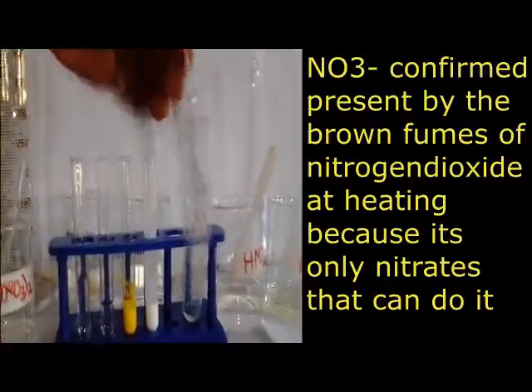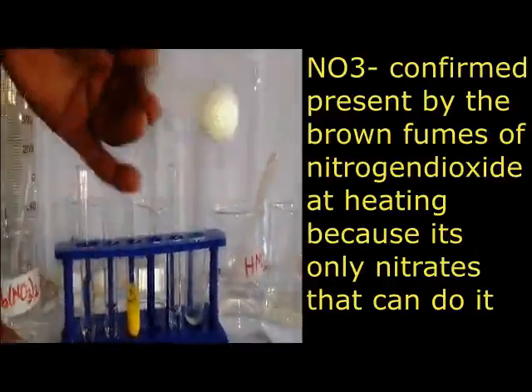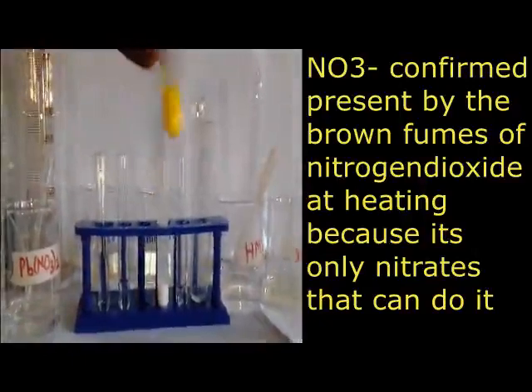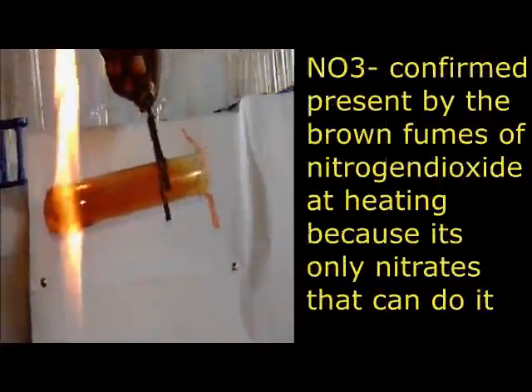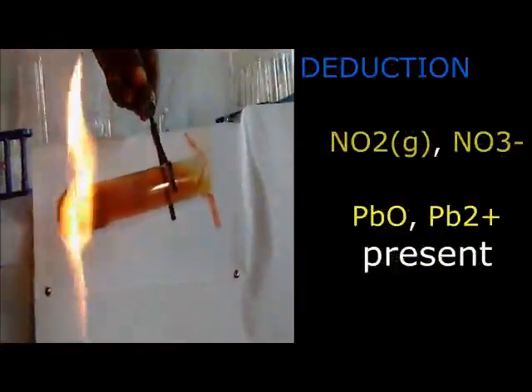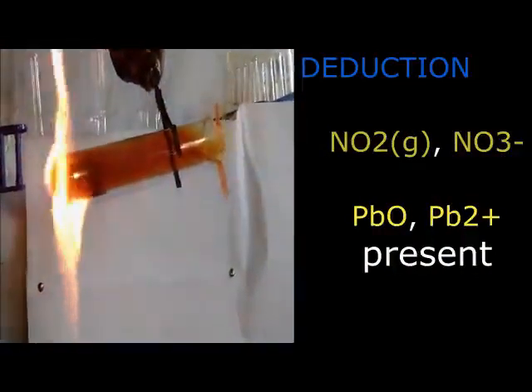Members, when you are recording, try to follow the question from top to bottom. What you have not recorded up, you don't record down. You can discover that our salt was on the zinc, aluminium, and lead list. But mere heating at the top, we removed the zinc and aluminium, because the salt was white, then turned reddish brown when hot, and yellow when cold.